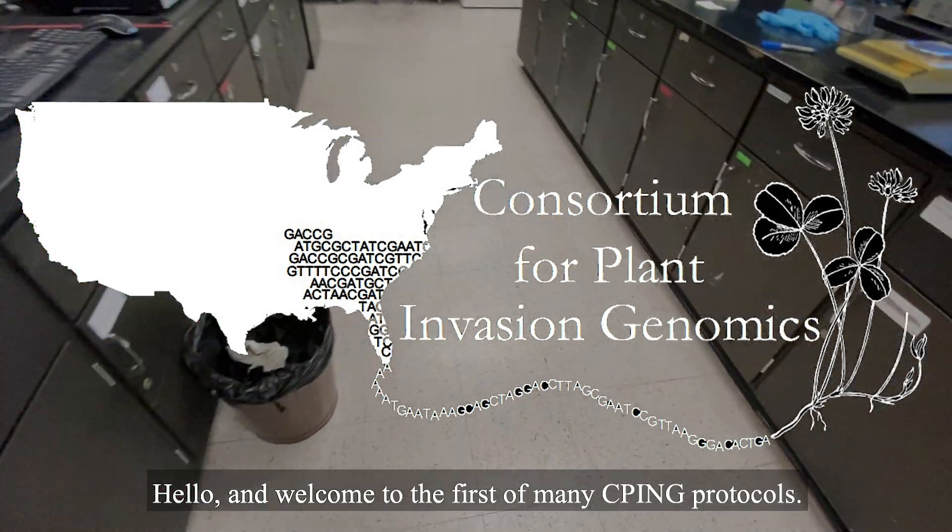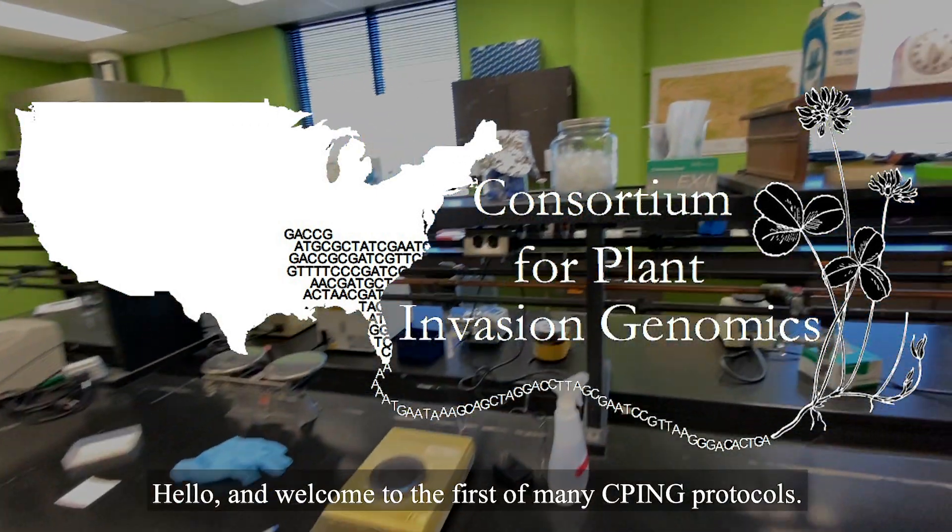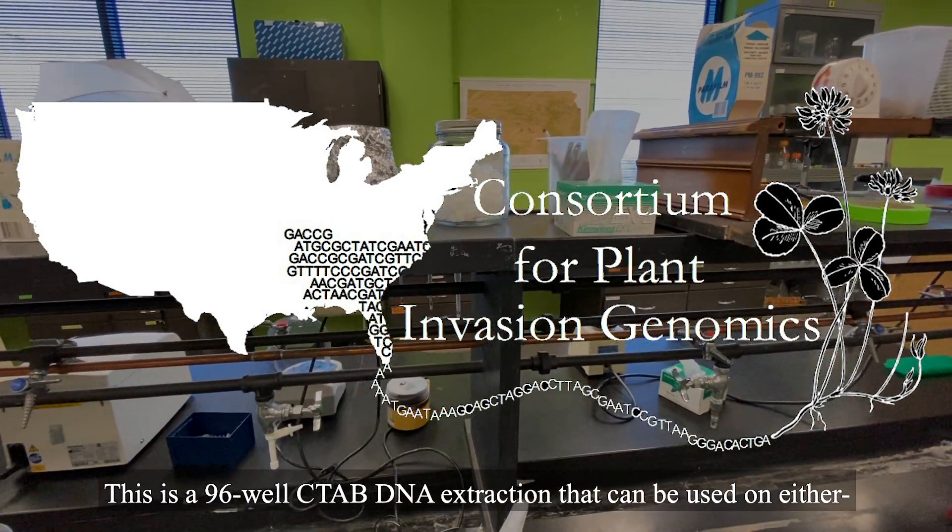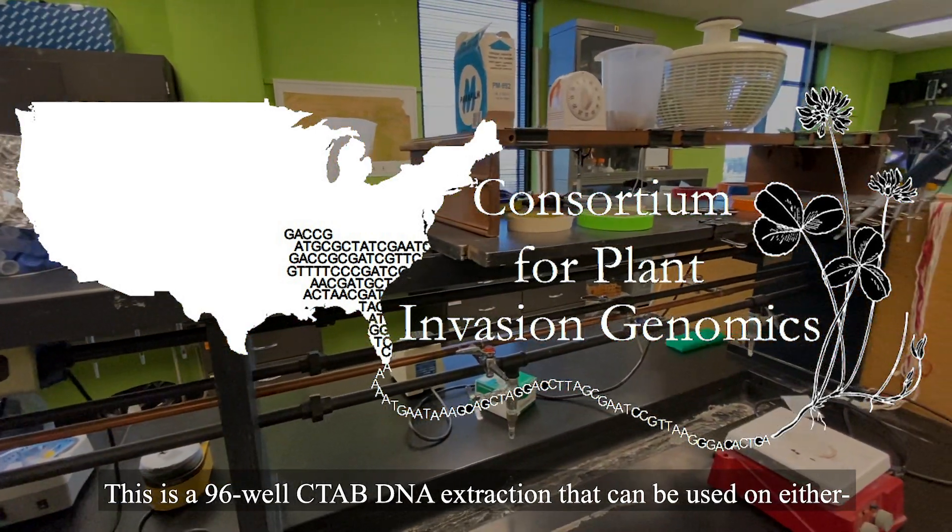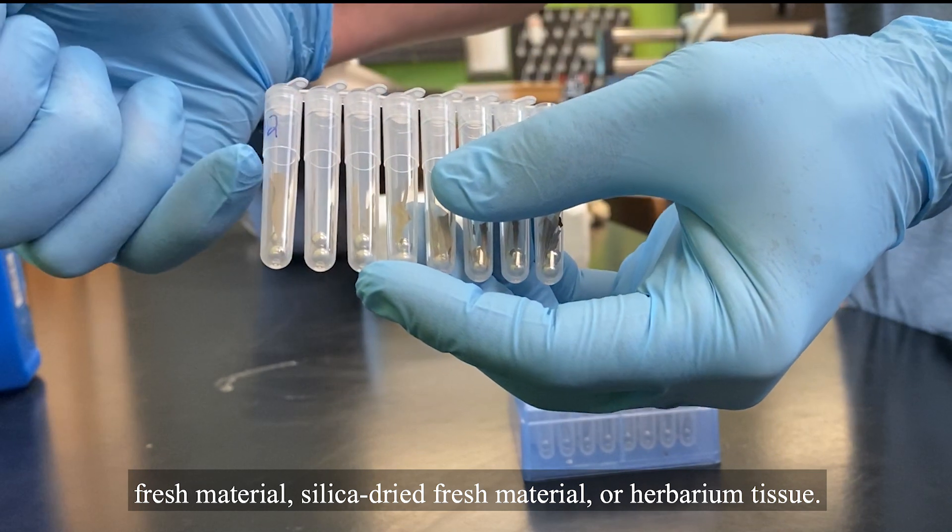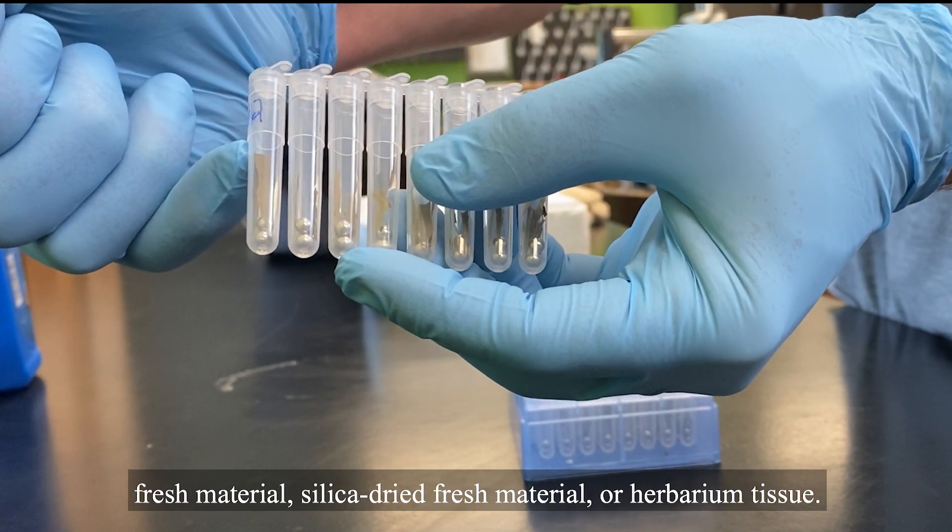Hello, and welcome to the first of many CPING protocols. This is a 96-well CTAB DNA extraction that can be used on either fresh material, silica dried fresh material, or herbarium tissue.